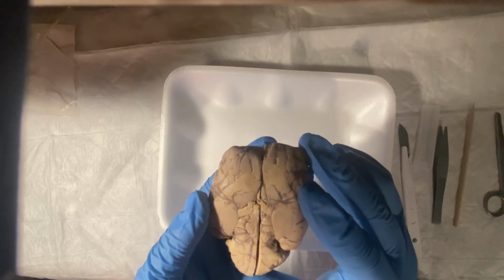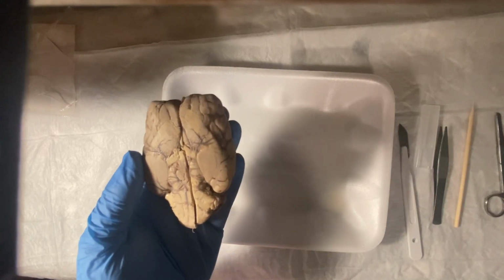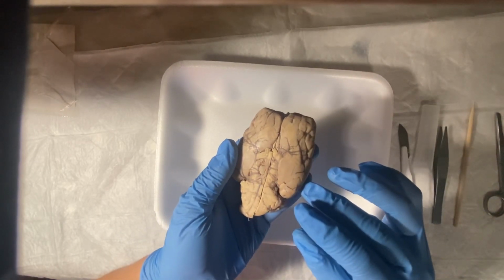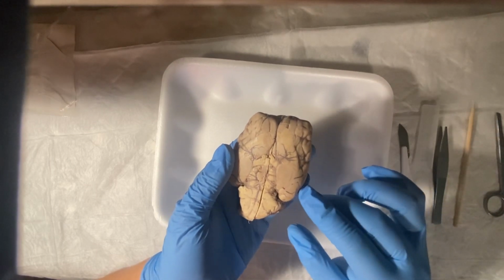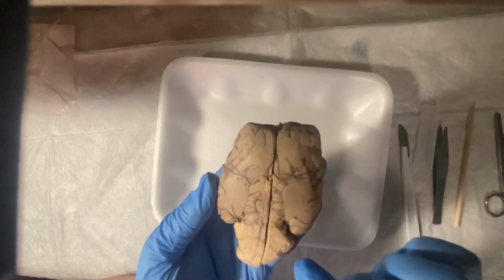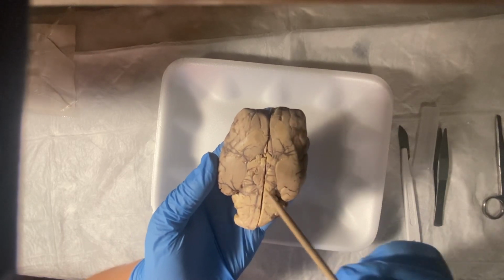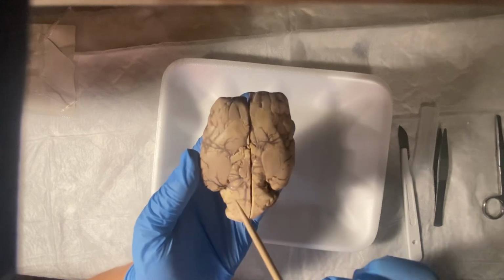And behind that, the next one will be the trochlear nerve, which is cranial nerve number 4, and that is very tiny. Those are very tiny, but you can kind of, let me get my, here we go. Can you kind of see them? Yes.